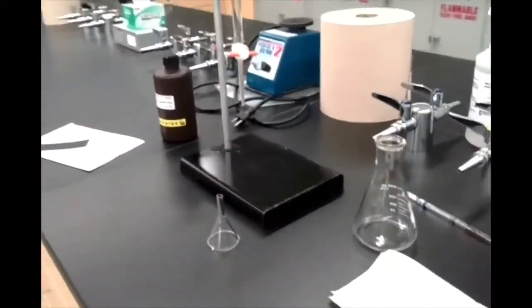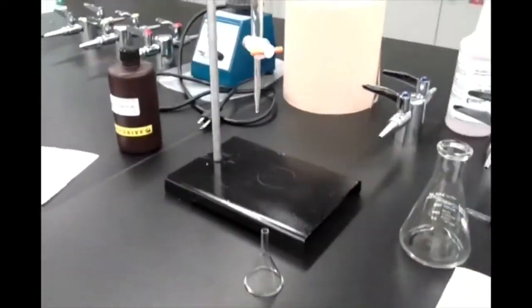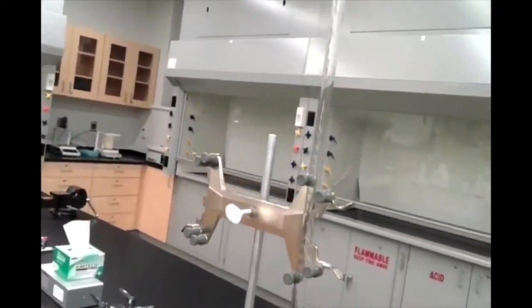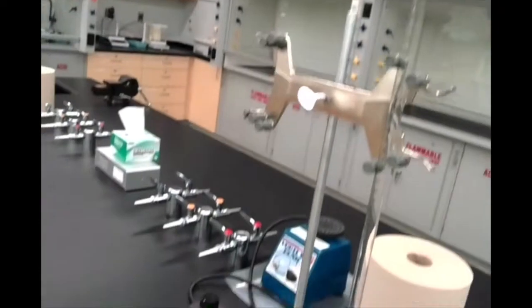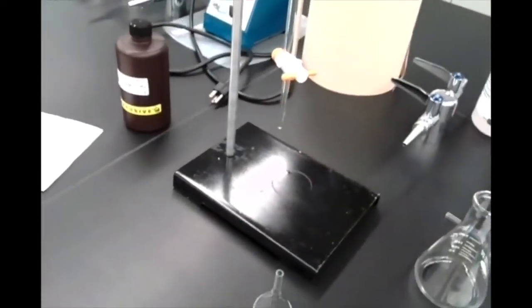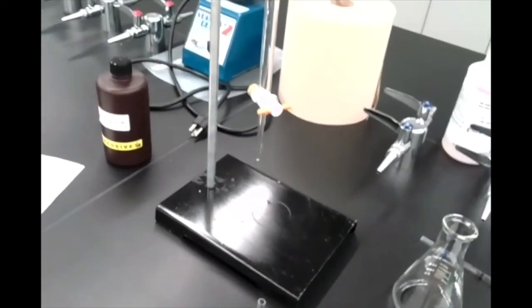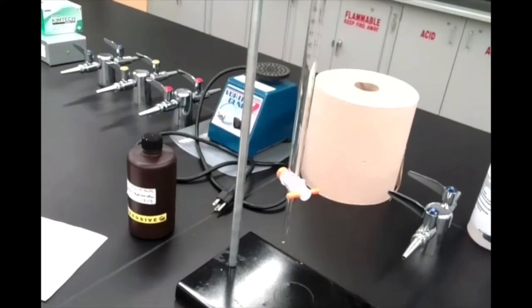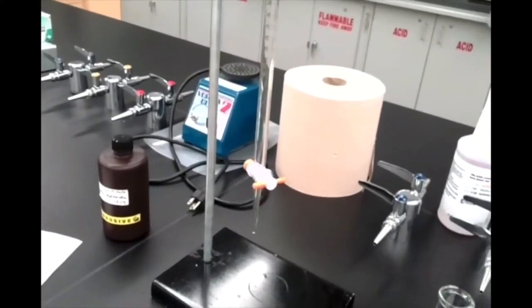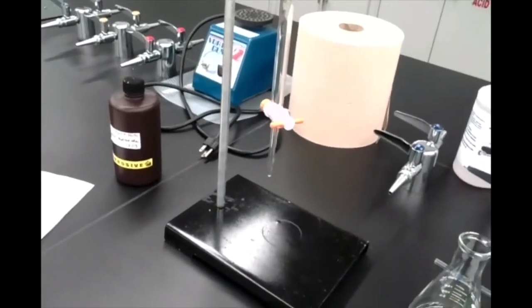The other piece of equipment we're going to need for our titration is called a burette. It is this long glass tube. It's open on one end. Well, technically it's open on both ends, but we have a tap called a stopcock at the bottom of it. And essentially we can use that to control the titrant that we allow to run through it. Our titrant for this experiment is the sodium hydroxide I mentioned earlier.